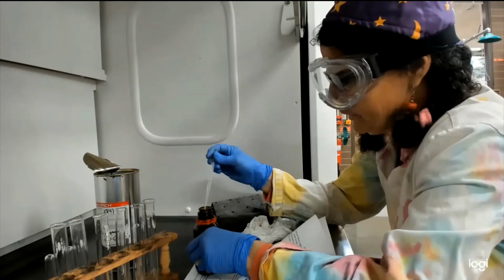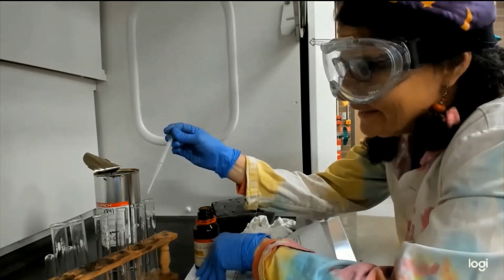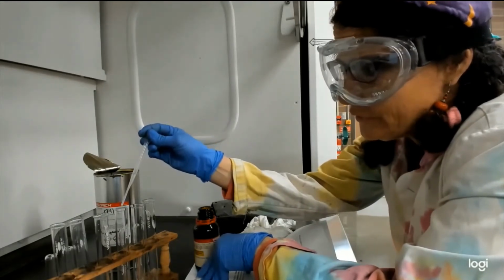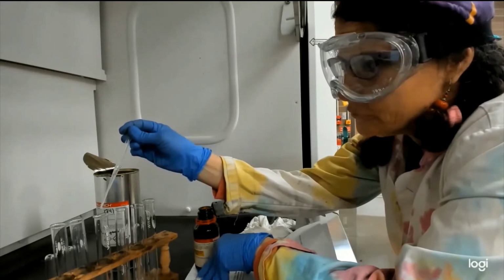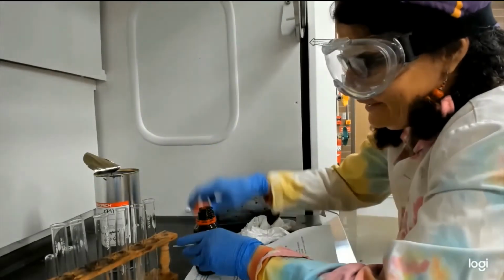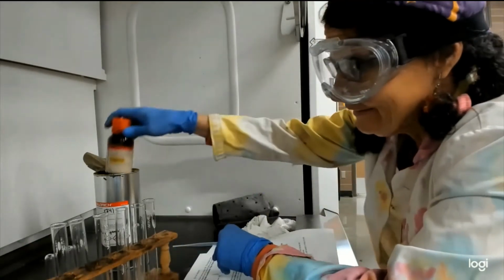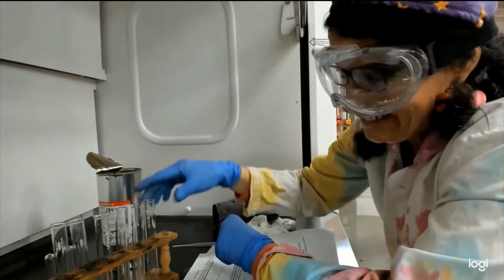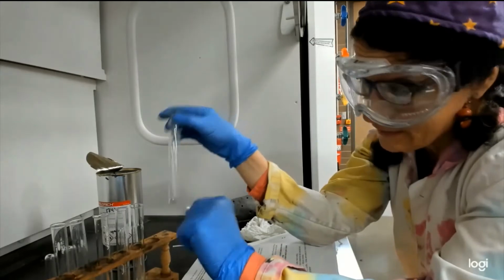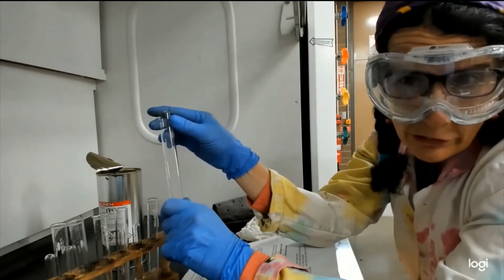So they got me a brand new bottle of this just for you guys. And oh, you guys can count my drops for me. So, wow. You see that? Really nothing. But if it's an alcohol. Oh, that's an alcohol.